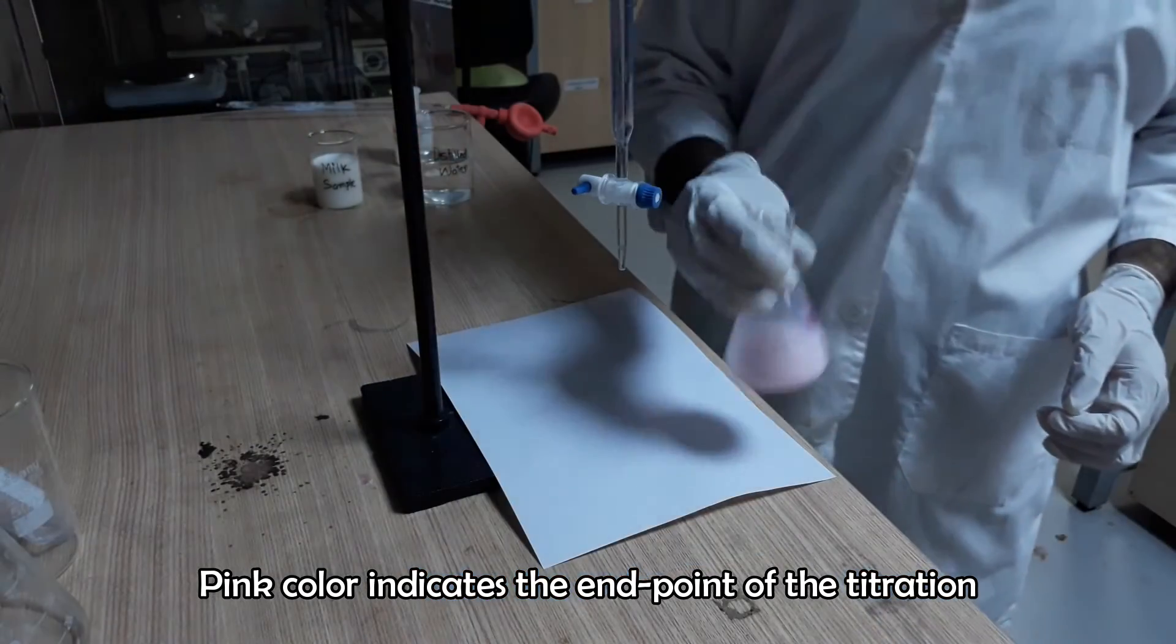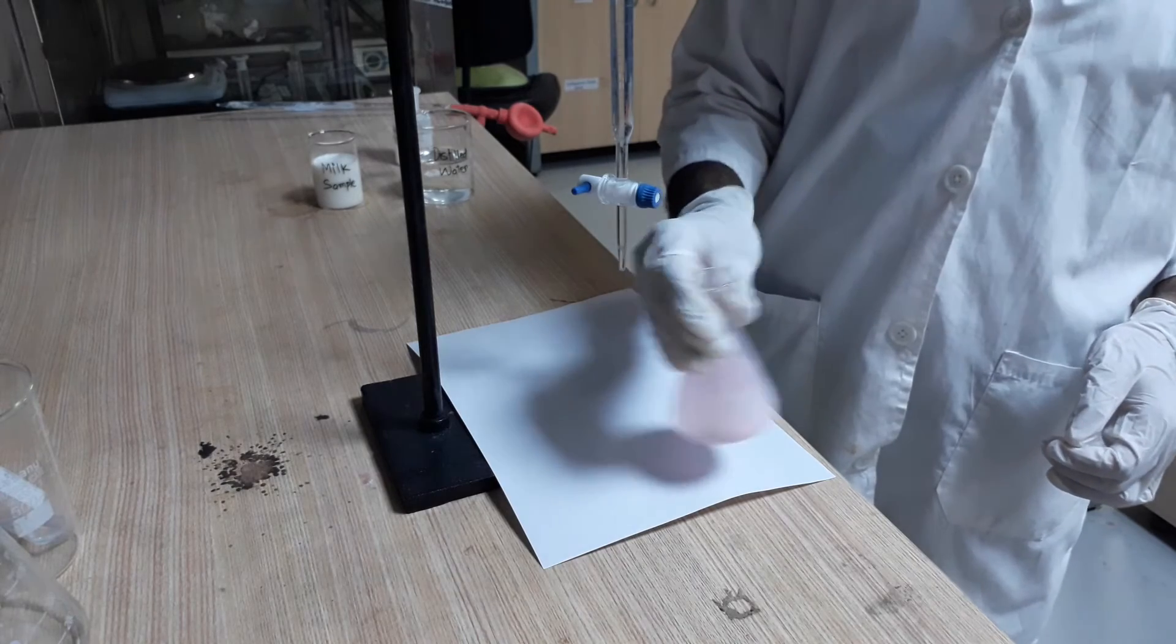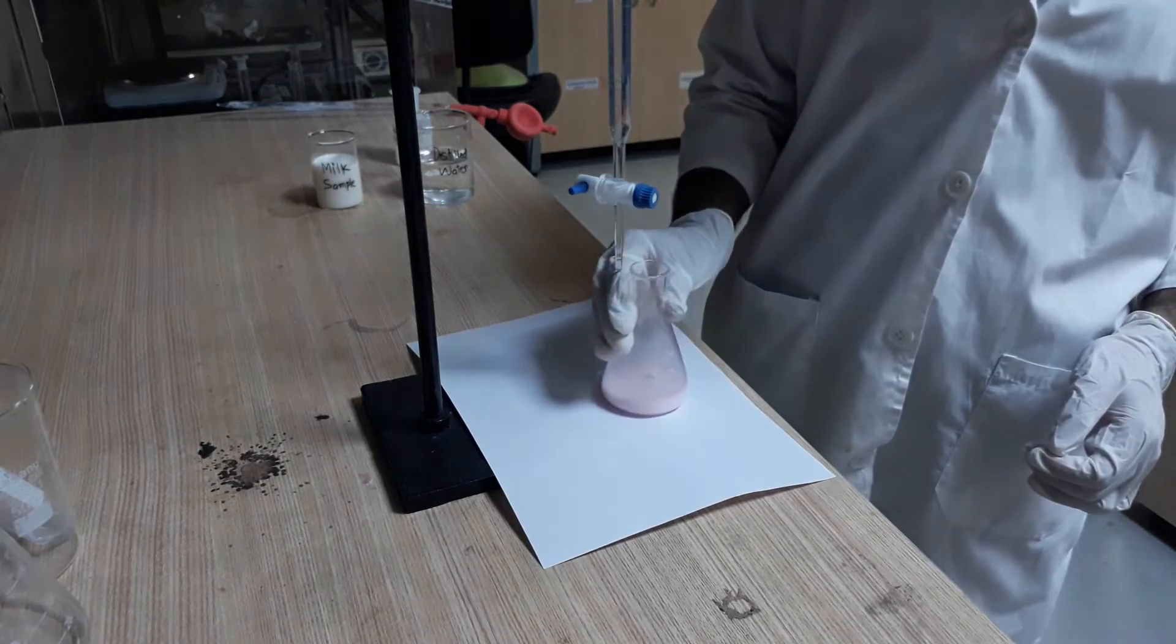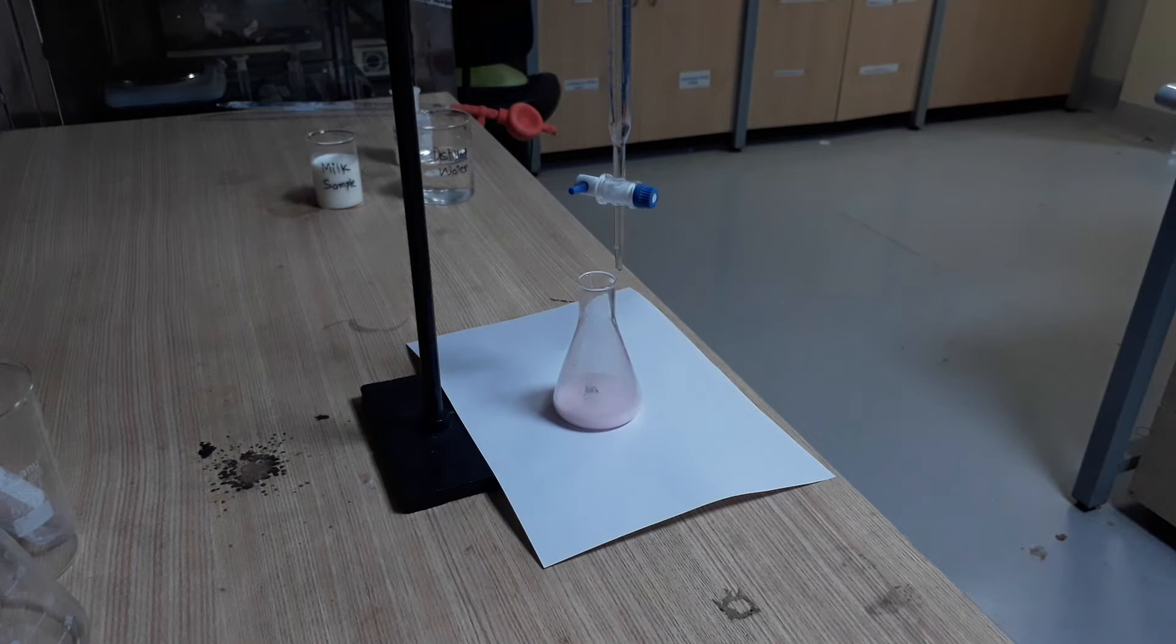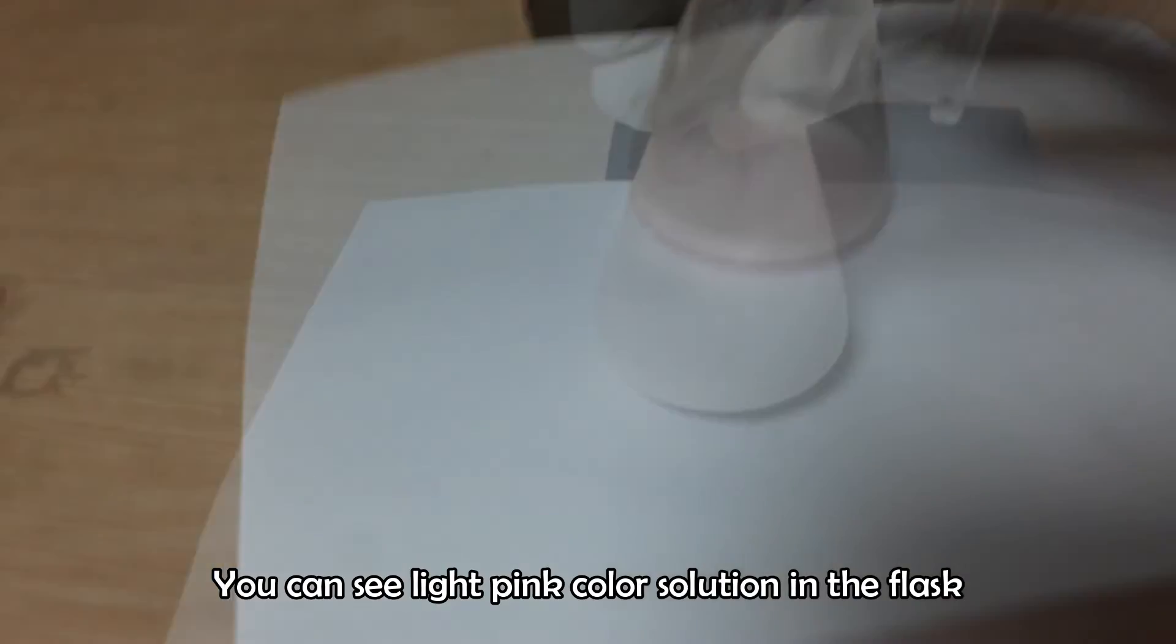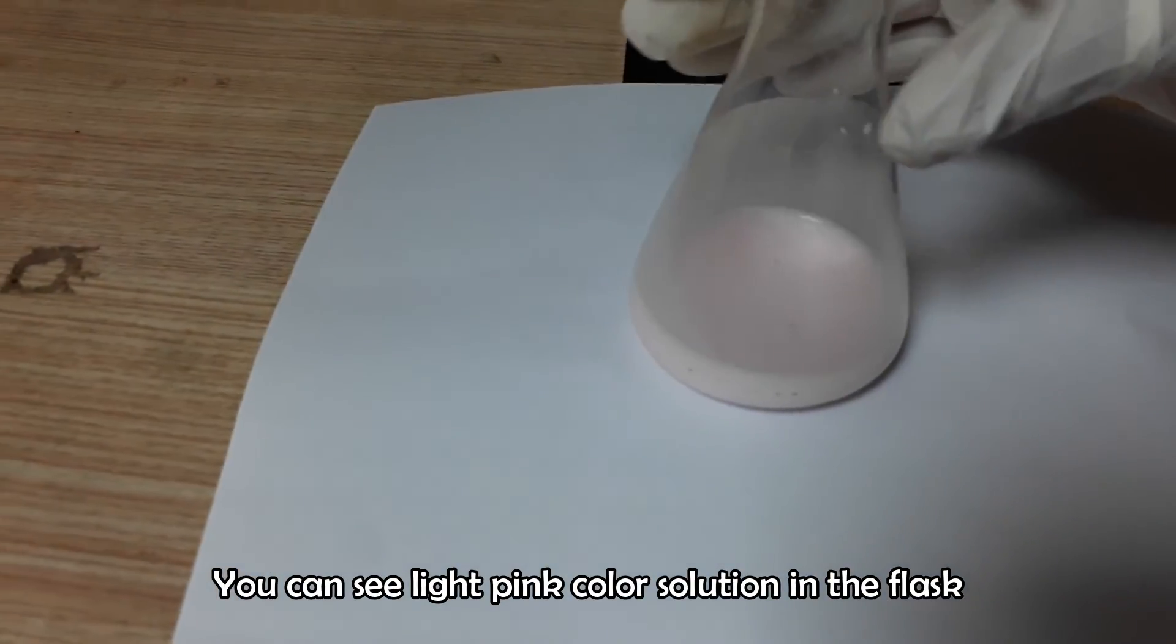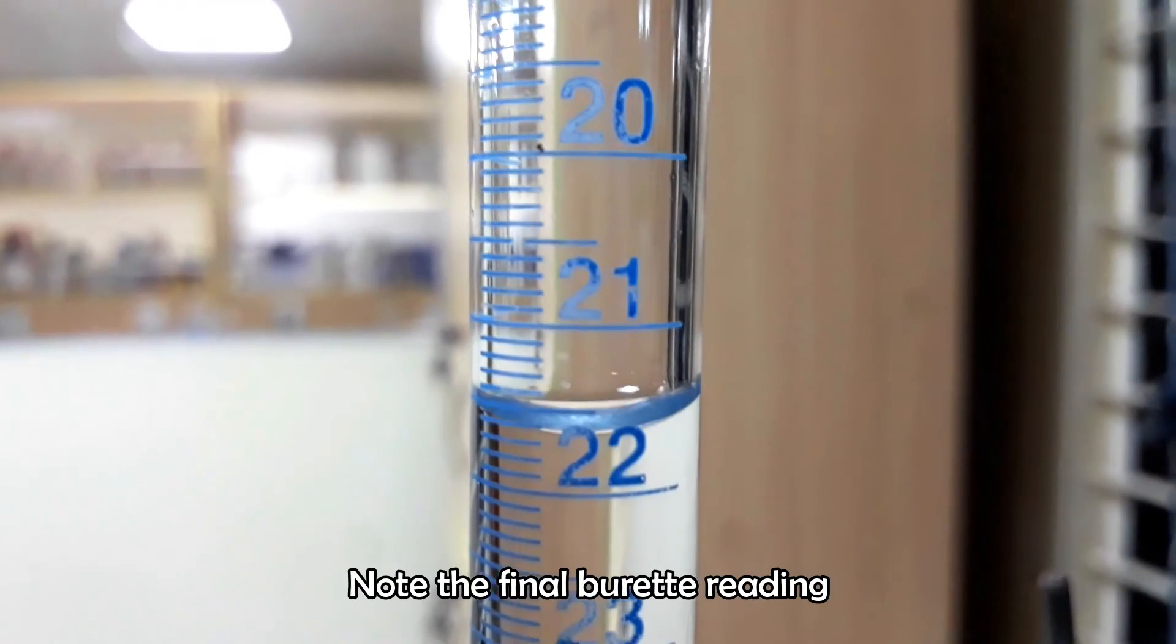Stop the titration when the solution color is changed into light pink. Note the final burette reading.